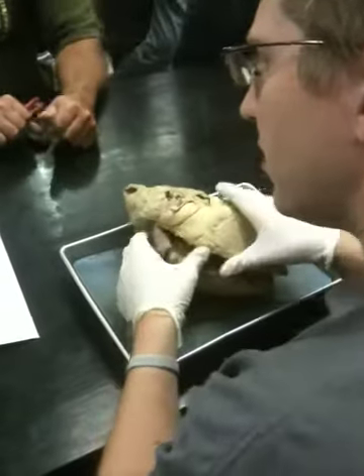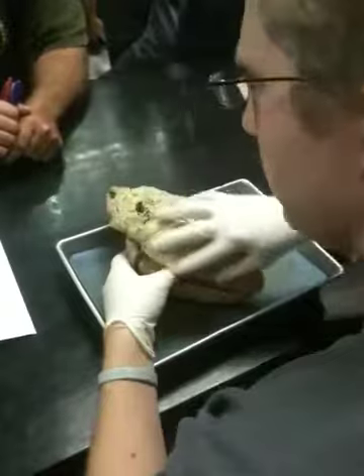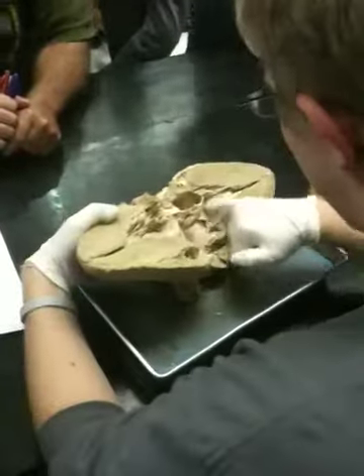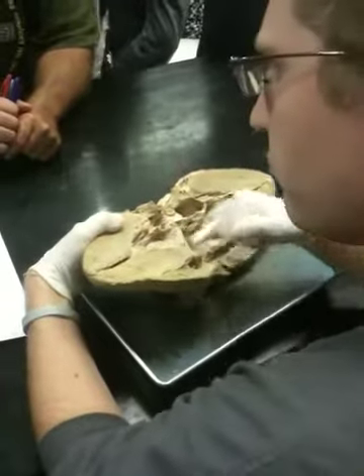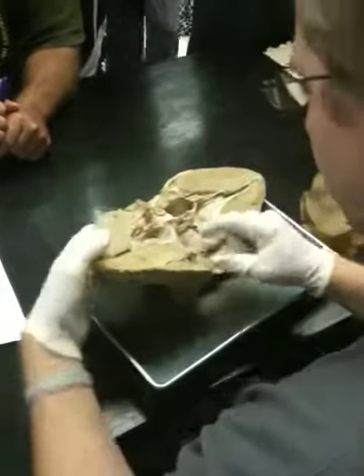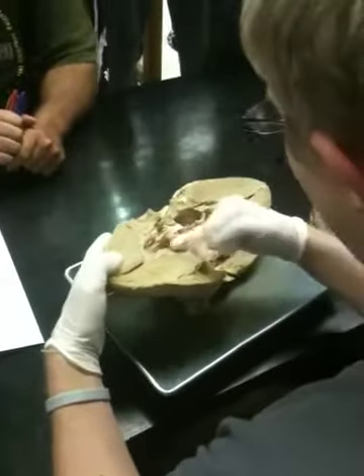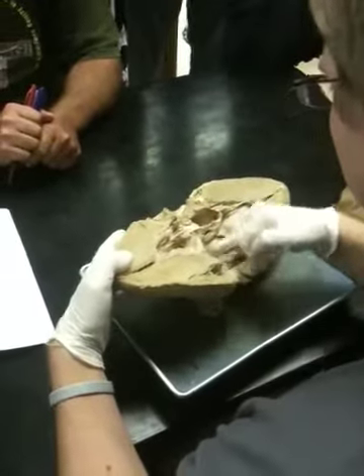Epicardium, that is the outside tissue. Myocardium is on the inside, and that's the shiny, smooth tissue. No, that's the endocardium. Sorry. Myocardium is actually the muscle. Endocardium is this shininess.